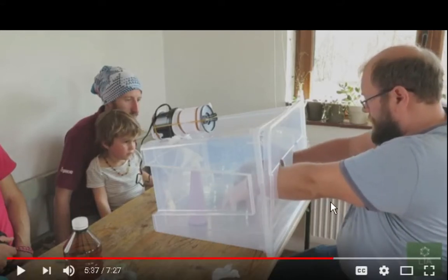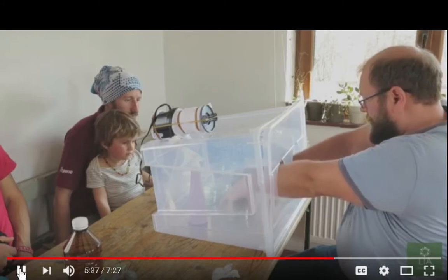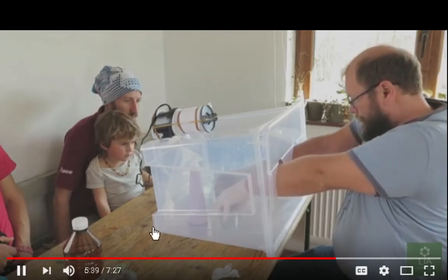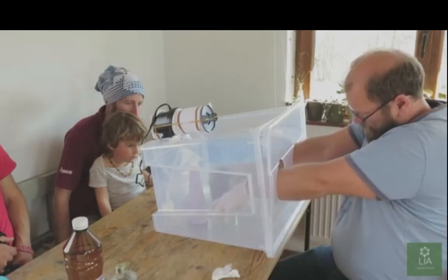And there's sleeves you can get to cover your arms, and there's the doctor's face mask and the head gear and the whole body suit and everything. He's not using any of that. You know, he just got the gloves on. I have the same setup pretty much.